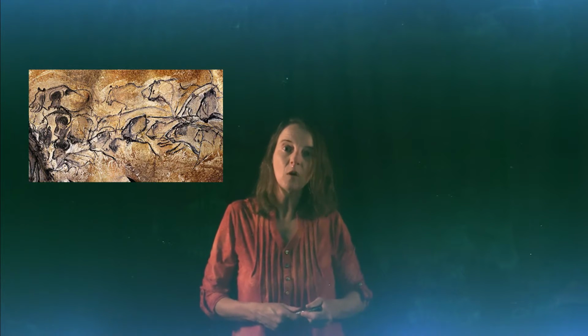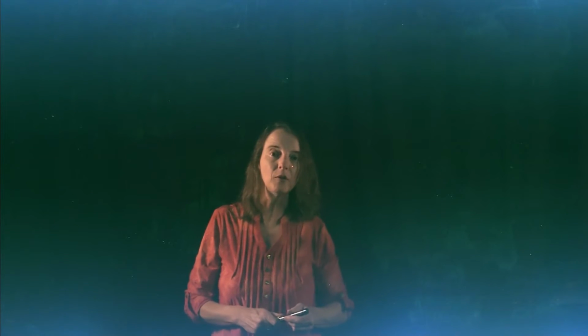In the lab, we are going to synthesize two different pigments, Prussian blue and barium white. We will try painting with our new pigments, and we will look at the optical properties of these pigments by looking at how they absorb visible light with a spectrometer.